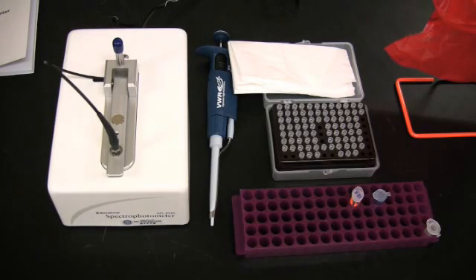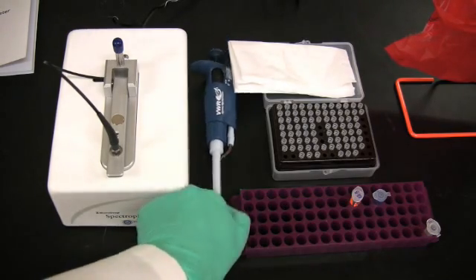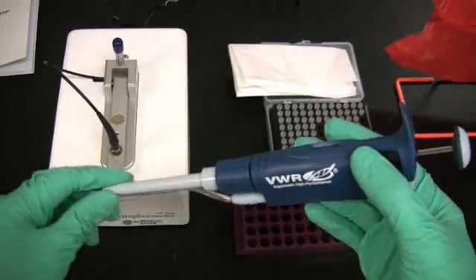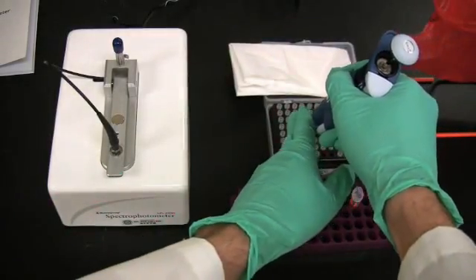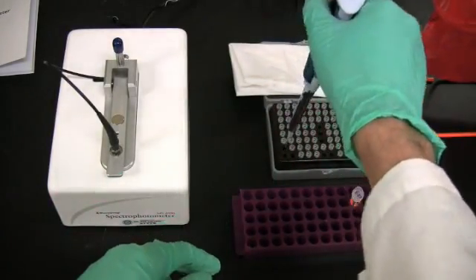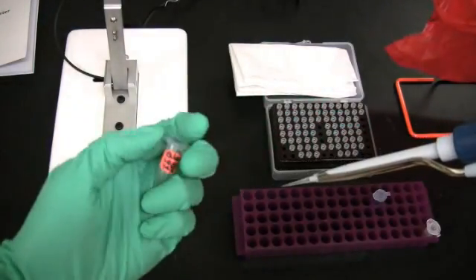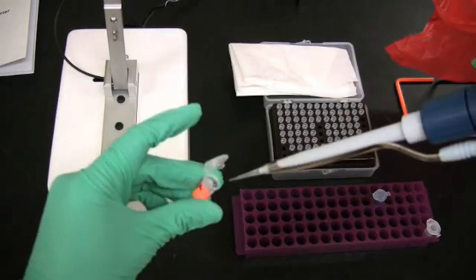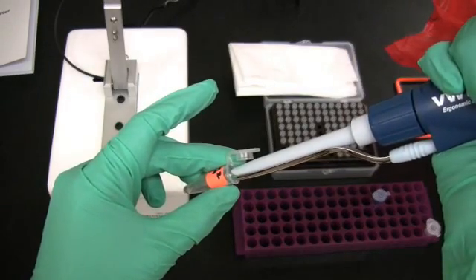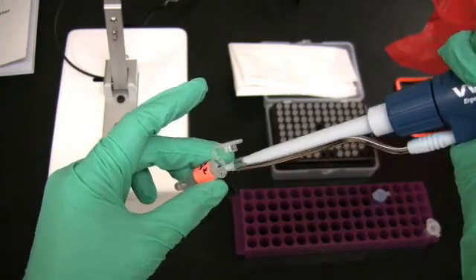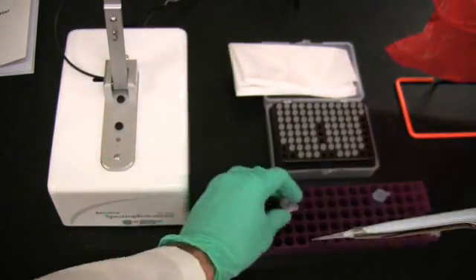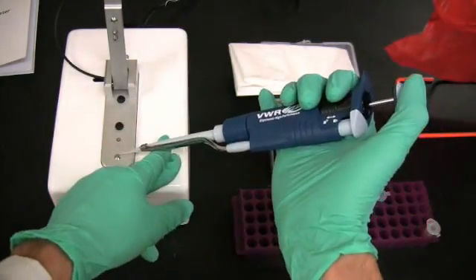After cleaning the pedestals, you are free to load your samples onto the lower pedestal. Do this in the same manner which was used to load the water sample for zeroing. As a reminder, make sure to load the sample onto the very center of the lower measurement pedestal. If the sample is loaded too close to the edge, proper bridging of water between the two pedestals may not occur, and measurement of the sample will not be possible. If you make a mistake, just wipe the surfaces clean and try again.